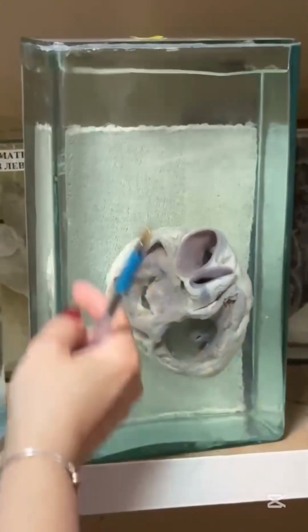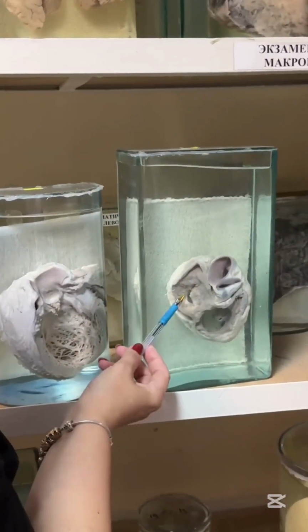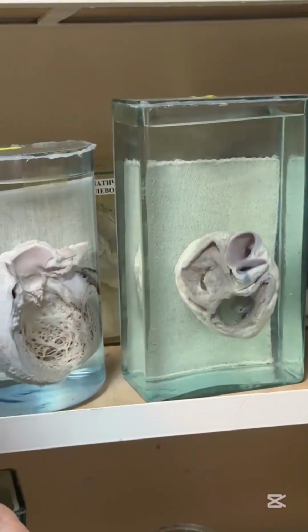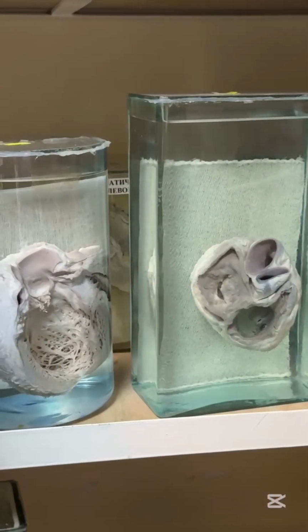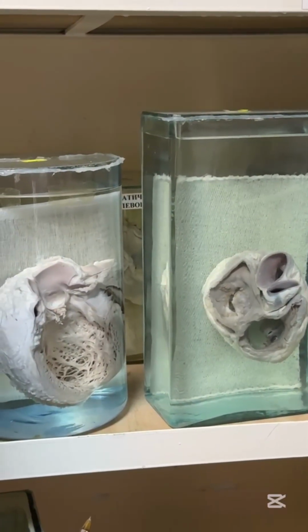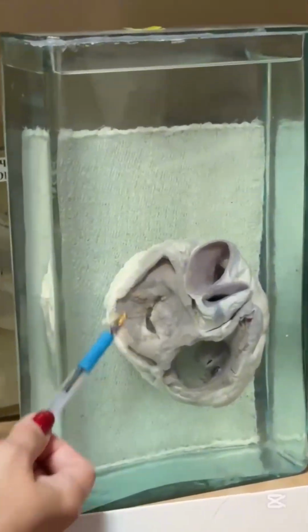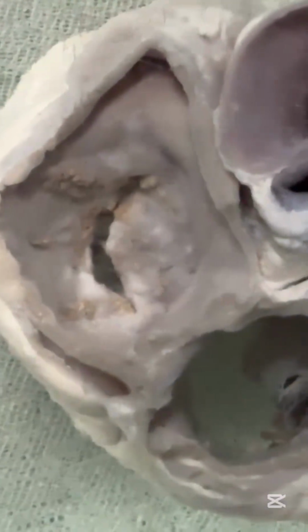Compared with this one, again heart, but here you see mitral valve, mitral stenosis. That is rheumatic heart disease, rheumatic fever, rheumatic heart disease. Again, you see vegetation on the surface, but not so big. That is aseptic inflammation, no any microorganism there. And clinically, it is heart failure because of mitral stenosis. It has name fish mouth, too.